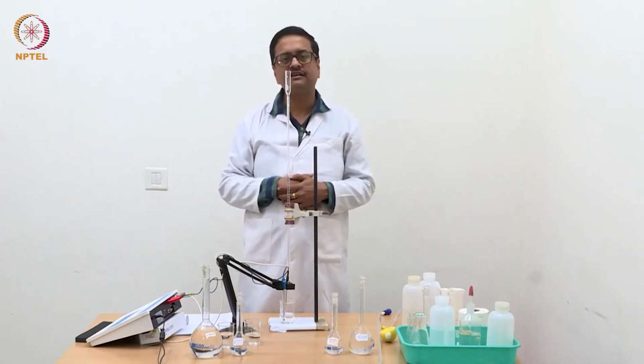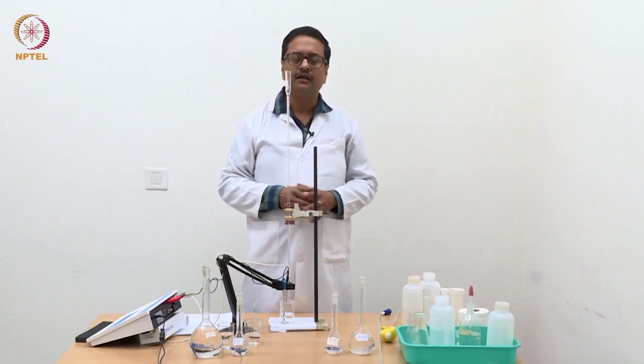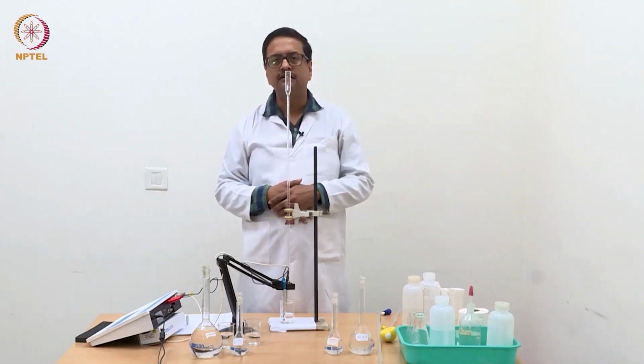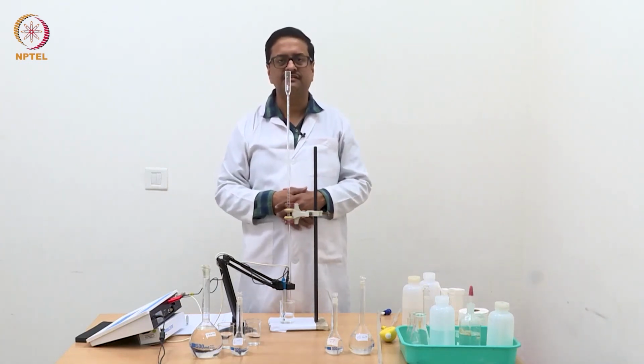I will discuss how one can plot these numbers efficiently and get a very good endpoint in the theory lecture that will follow this experiment demonstration.